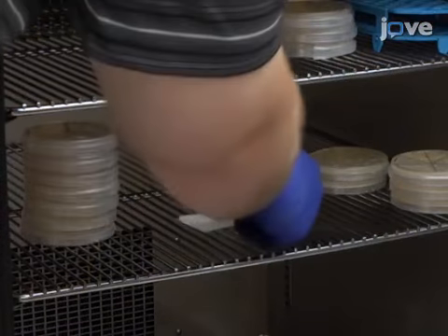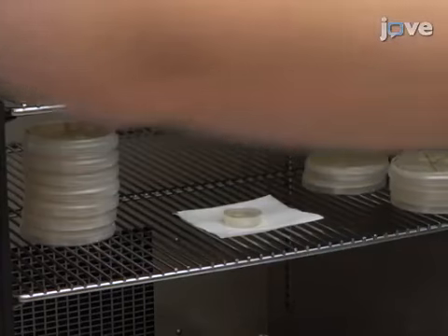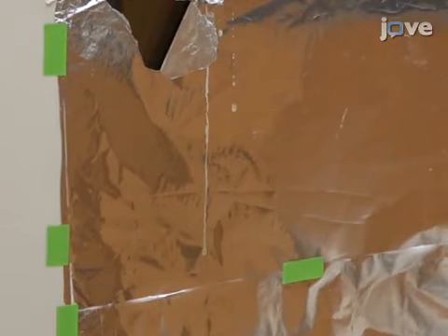Incubate the cells in the culture dish for 30 minutes to an hour, in the dark, at the temperature the microscopy will be performed.